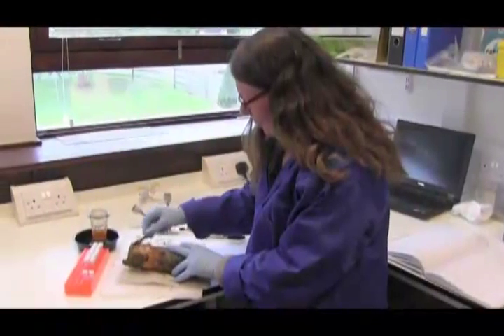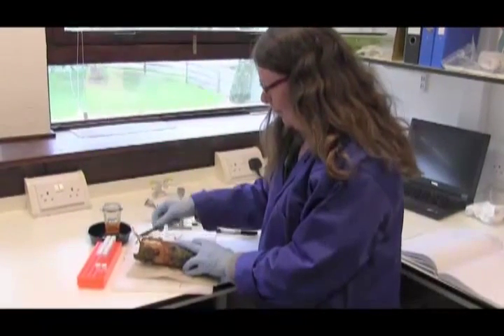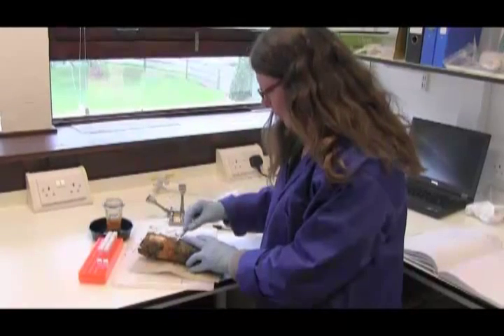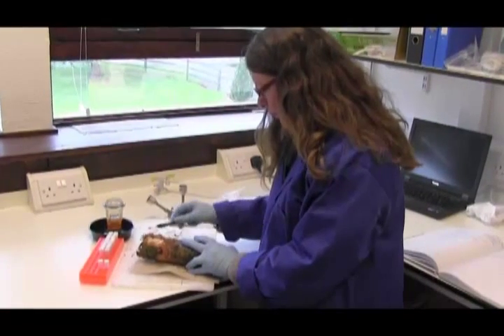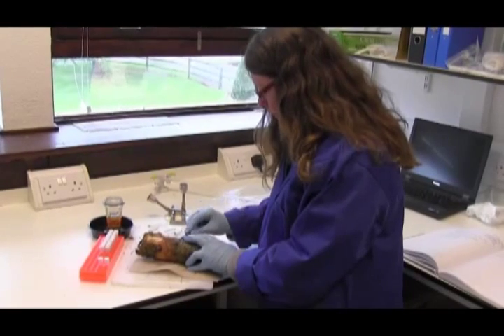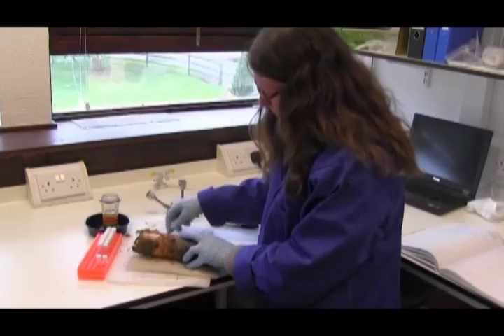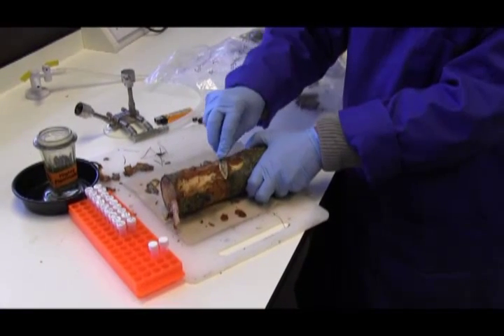First of all, when the sample comes in, we examine it, look at the symptoms, and then make some judgement on whether we can culture any organism that's there — usually the Phytophthora — from that material. If we don't think it's good enough for that, then we will rely on DNA detection.